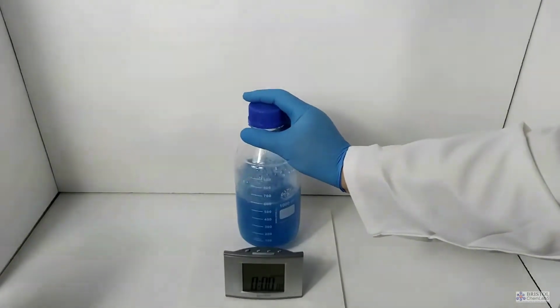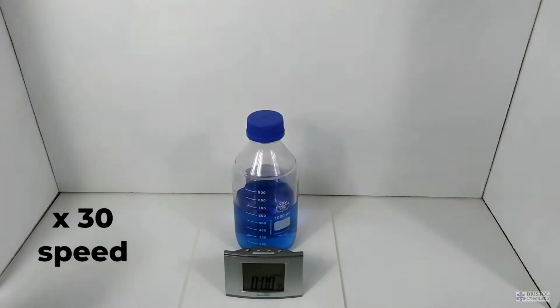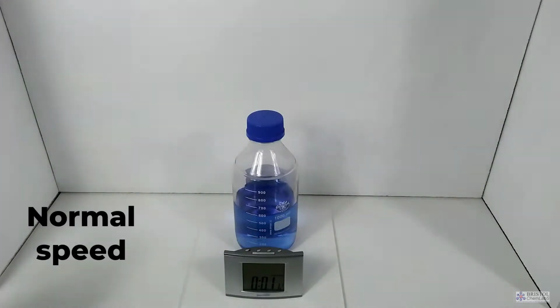The experiment can be used in a number of different ways. The most obvious one is to show reversible chemical change in a simple form. You could use it as a lesson starter, asking the students what's causing the change.